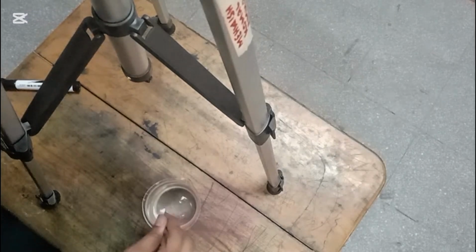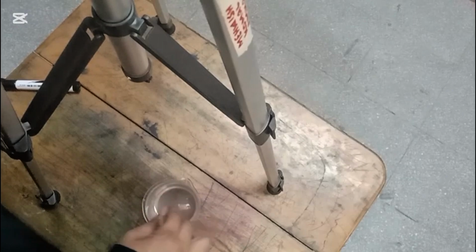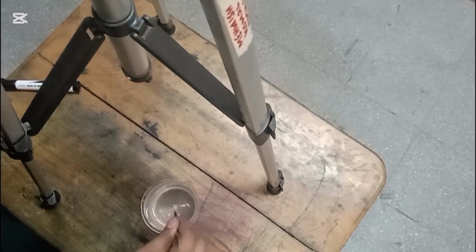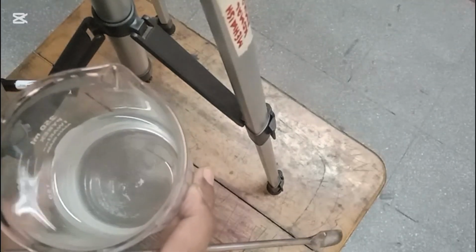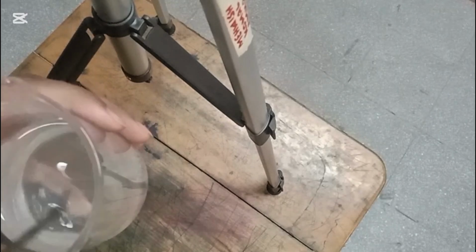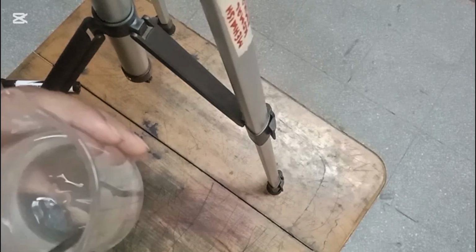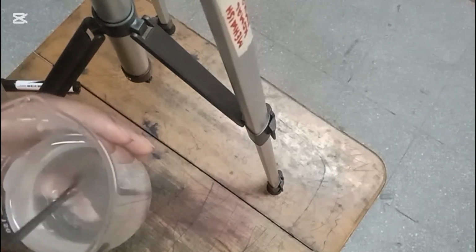You can see that I am continuously stirring this solution because I want to dissolve all the particles of the salt in the water. By adding it in the water, you can see that there is nothing left in the solution, unlike a suspension, it is a homogeneous mixture. There is some salt left in the bottom of the beaker, but when we continue our stirring, you can see that nothing is left or settled down in the bottom of the beaker.